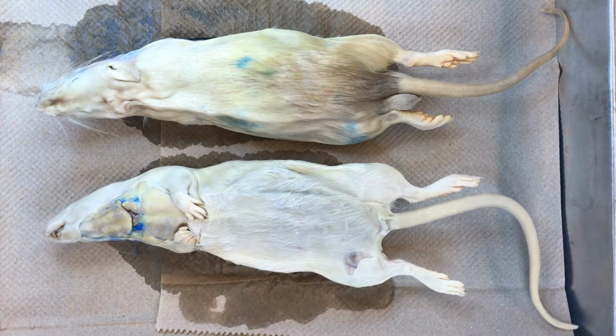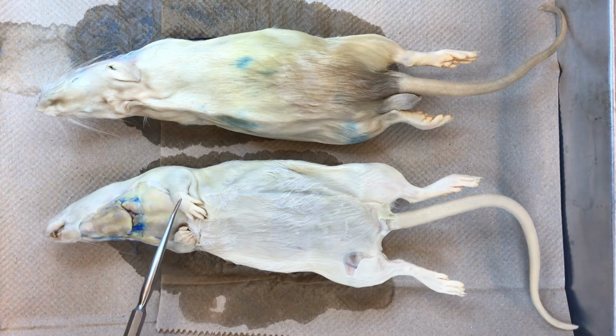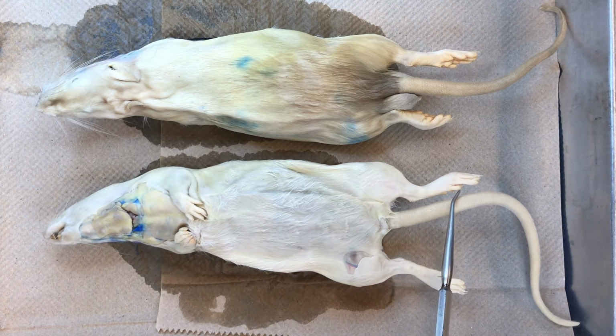To begin your Unit 5 dissection of the white rat, we will begin by examining the external anatomy. Here you can observe the rat's general body shape, including the elongate tapering head, thick neck, heavy body, and long scaly tail with scales made of keratin. The rat has 4 limbs. All are short, but the hind limbs are longer than the forelimbs.